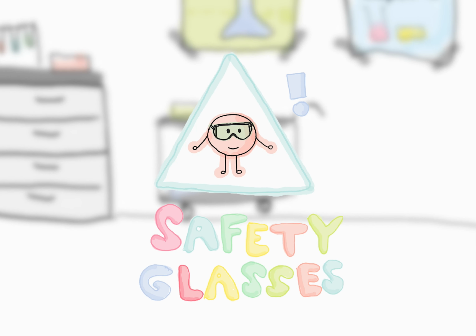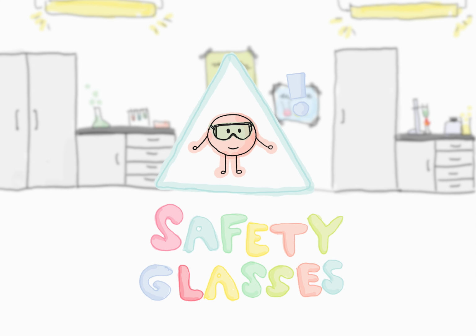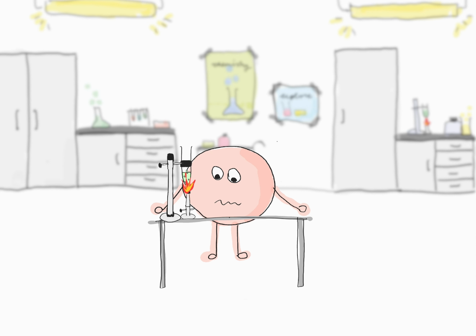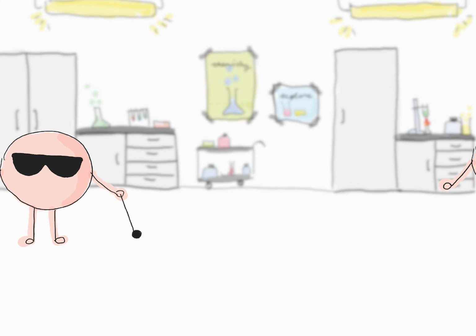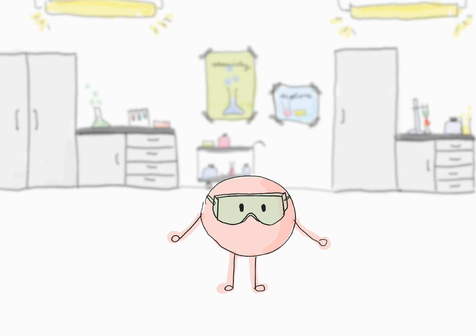It is also highly important to wear safety glasses during experiments. Hooray, safety glasses. I remember when one of my classmates made a test tube explode by heating it too much. Pieces of glass flew all over the place. Without the glasses, that could have been an eyesore. Okay, I have to admit that I was really glad about them at this moment.